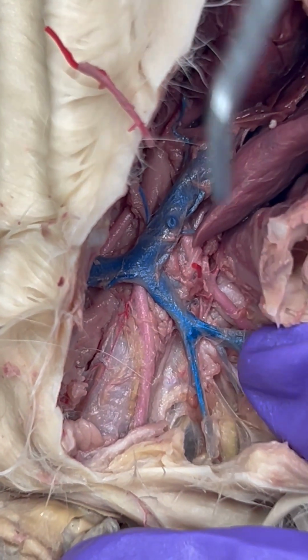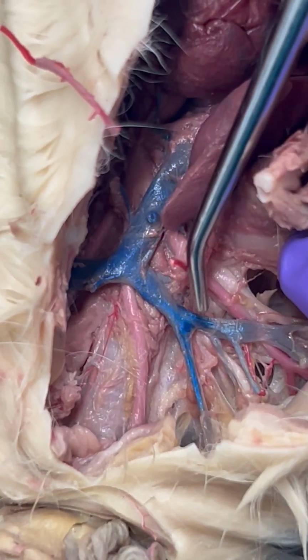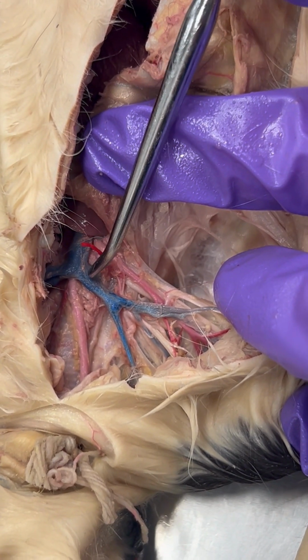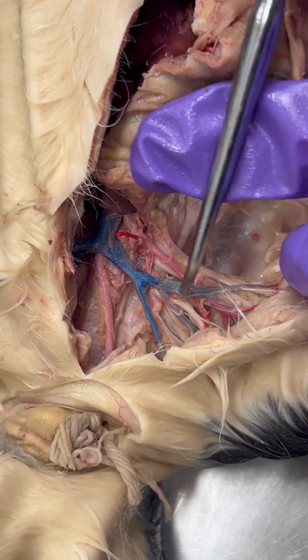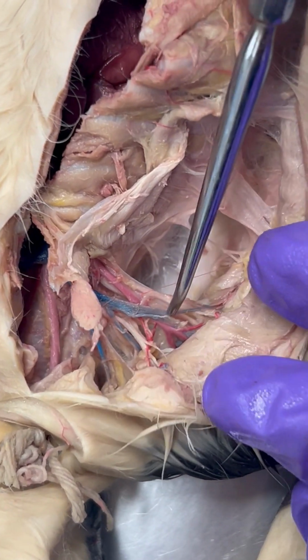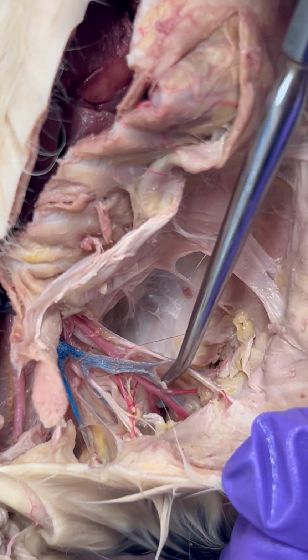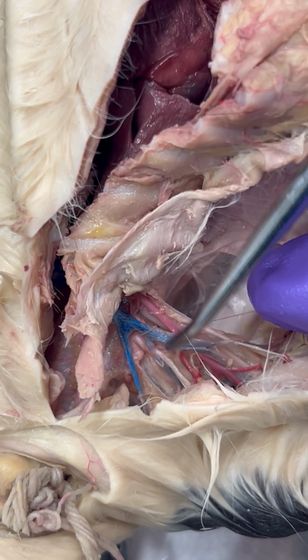And then we're going to have our axillary vein. We already know that our axillary artery is over here. So here's our axillary vein. Here we have the subclavian vein, the axillary vein, which going towards the arm becomes the brachial vein. The dye is not prominent in that area, but going towards the arm, it becomes the brachial vein. And up here, we have the subscapular vein.